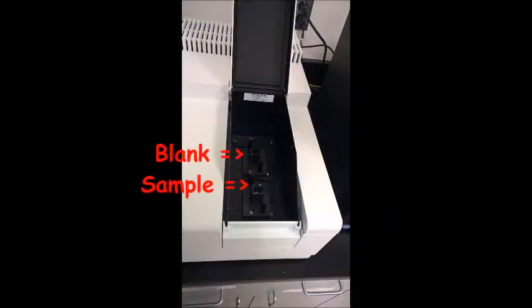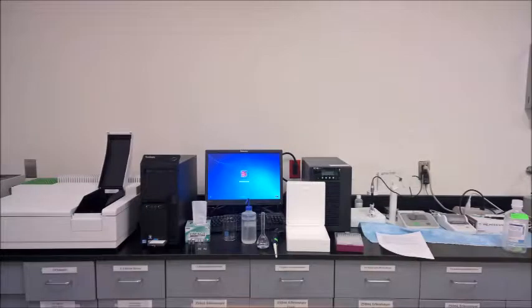There are two cuvette holders. The one in the back is for the blank solution and the one in the front is for the sample. To conduct a scan, we will need a pair of cuvettes.